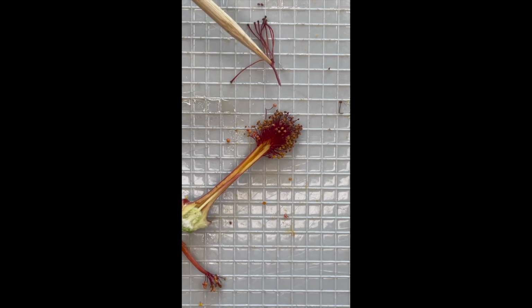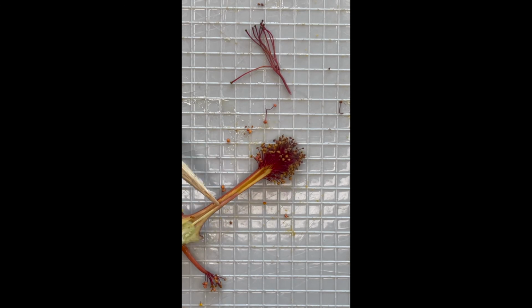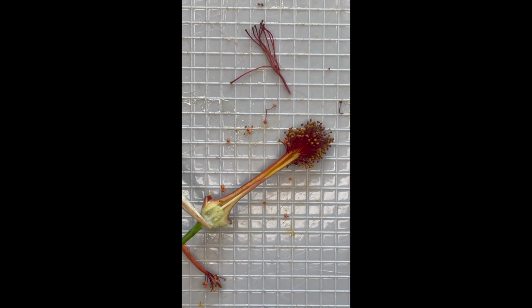You can see here that we have 1, 2, 3, 4, 5, 6, 7, 8, 9, maybe more of the stigma and styles. You can see where it connects to the pollen tube right here. The pollen tube goes down. Here's where we severed it by accident. It goes down into the ovary, connects to the ovary. You can see the ovules inside the ovary, those little round things. So the pollen goes from the anther to the stigma, travels down through the pollen tube, and fertilizes the ovules down there.